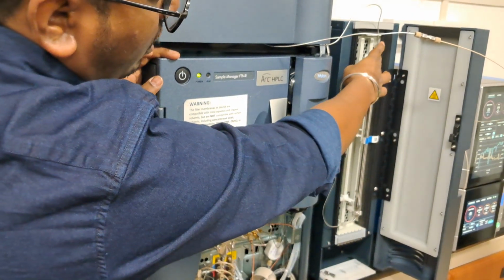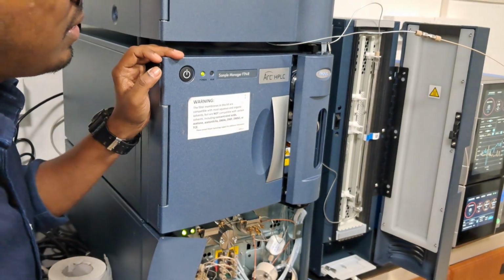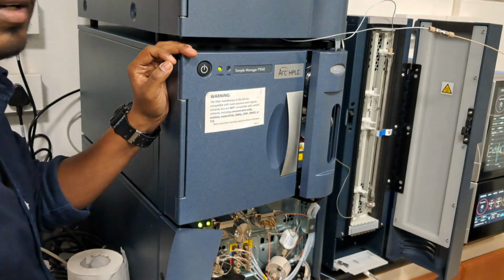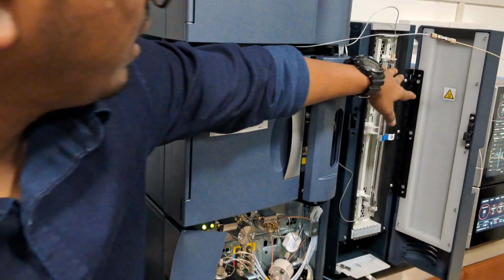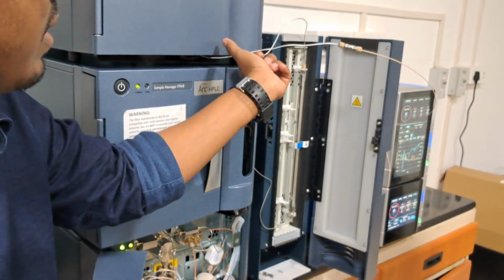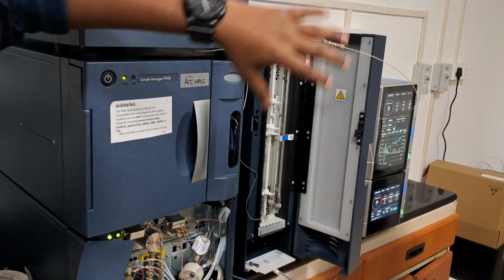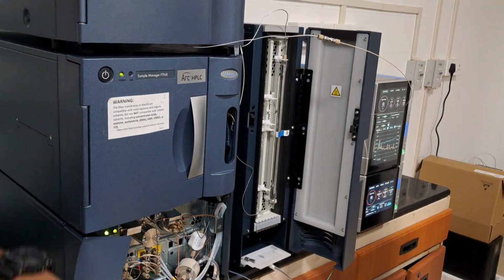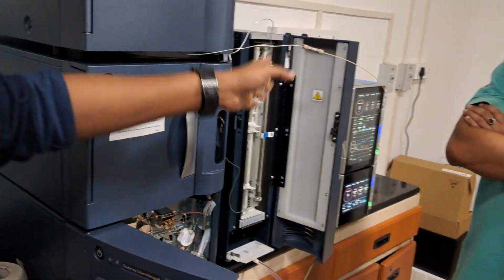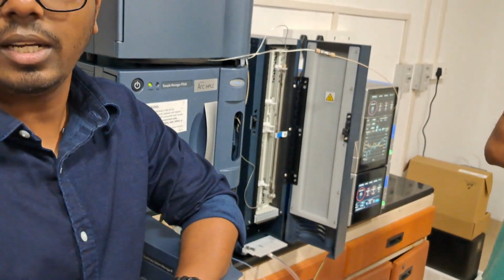If you remove the outlet of the column, it may give a variation of around 100 psi. If everything is in the closed loop, it may give an additional 200 psi. Up to the column, it gives around 1400 psi. Once I connect it, it may add a pressure of 50 psi, so with the difference, everything in a closed loop will come to around 1500 to 1600 maximum. This depends on the temperature, the previous mobile phase and this particular column. Yes, it depends on the column, mobile phase and everything, and gets varied.